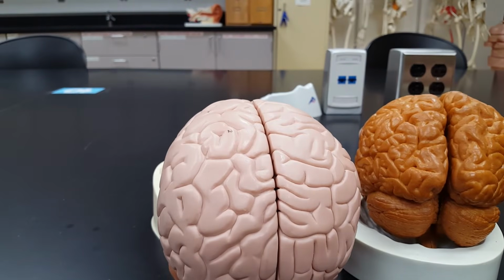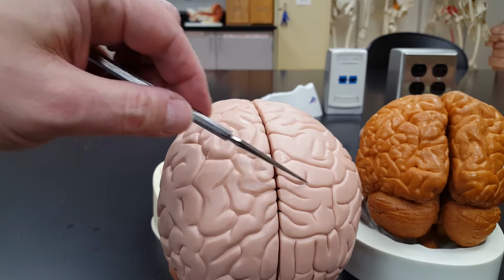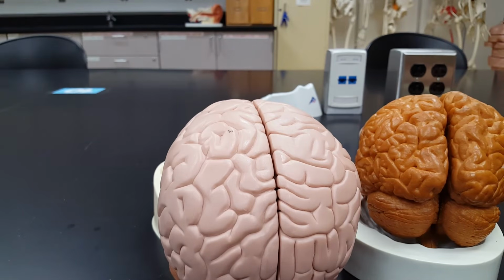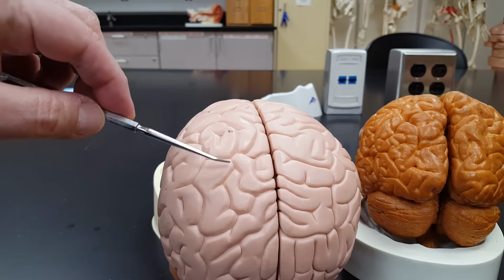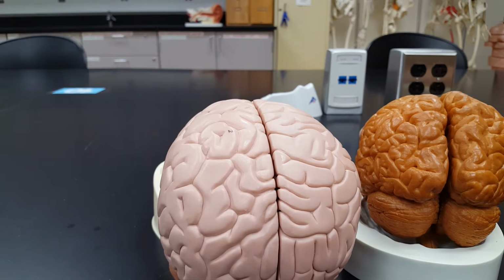And the cerebrum has a couple fissures in it. Deep depressions. Now, I want to point out a few structures here to you just so you have the terminology right. So yes, the cortex of your brain has a lot of wrinkles in it that increase the surface area. These small wrinkles that you see here, here, here, over here, each one of those is called a sulcus. I'll say that again, sulcus.